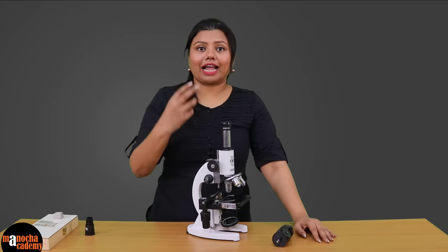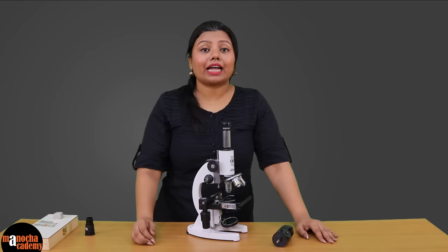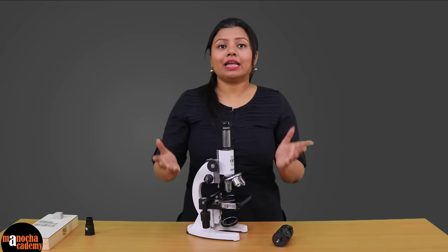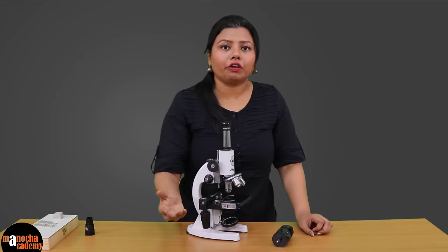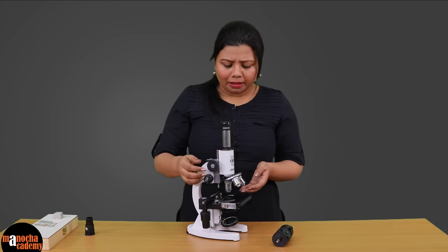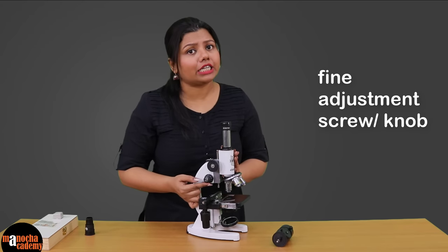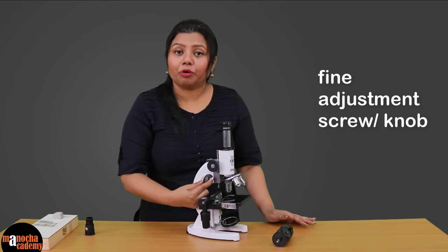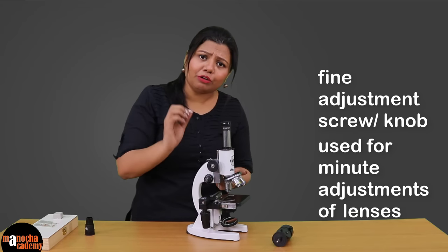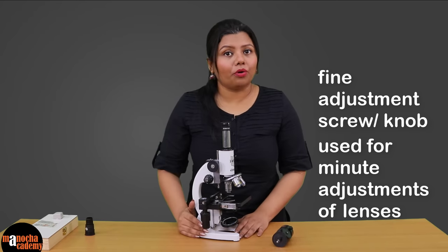We all have different powers in our natural eye lens. Even after focusing with the coarse adjustment screw, it may be exactly focused for my eye lens but not for yours because you have a different power. In that case, you might want to make fine adjustments without completely moving the body up and down. For that, we have the fine adjustment screw — when rotating it, there is no movement of the body. It adjusts the lens very minutely without moving the entire body, and with this you can bring the specimen to your own focus.